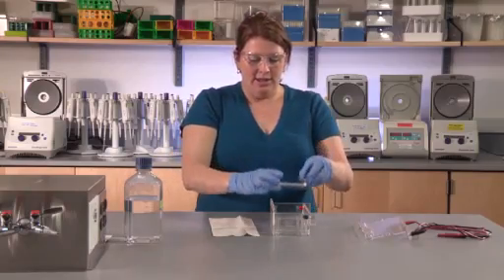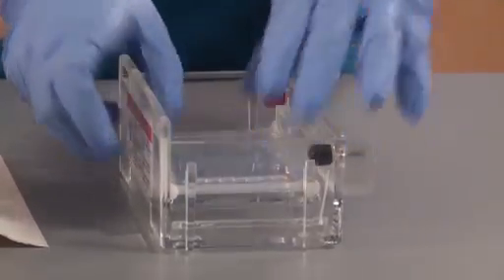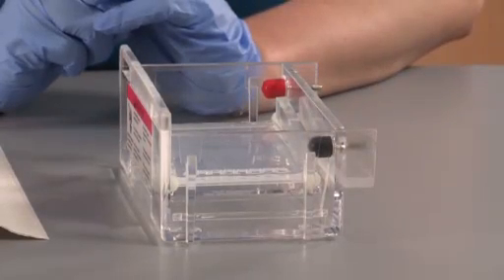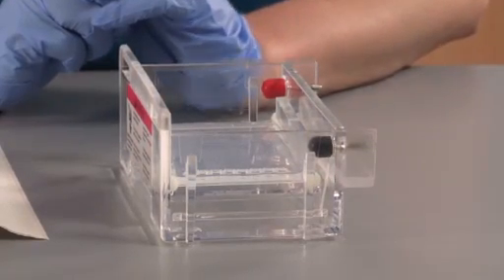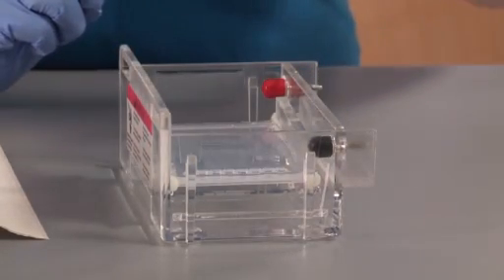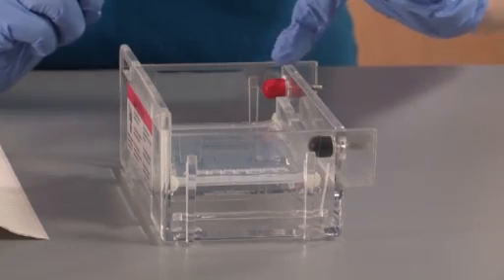Place the gel into the electrophoresis tank, being certain that the wells are at the top where the black lead is, because the current will be running down to the red lead.